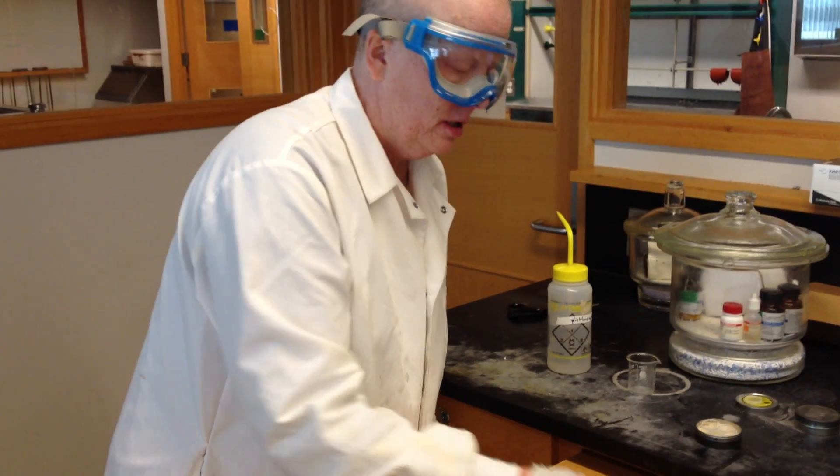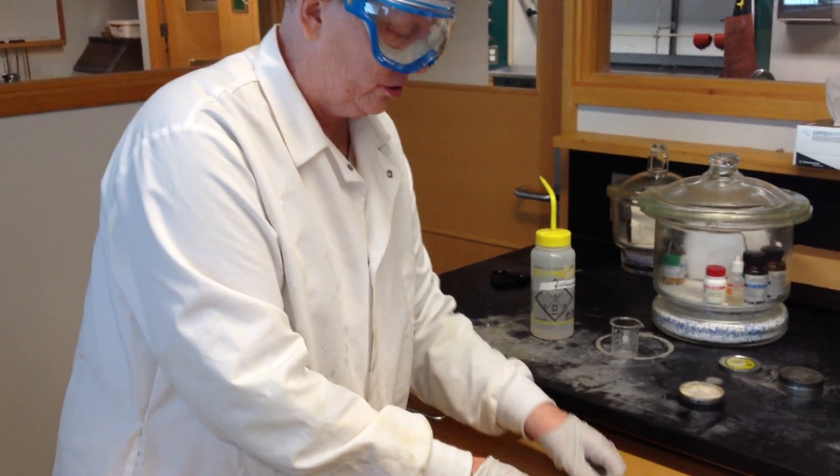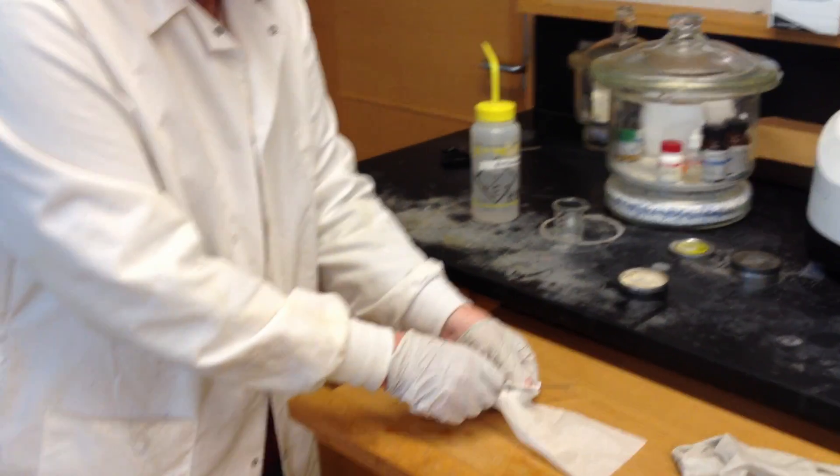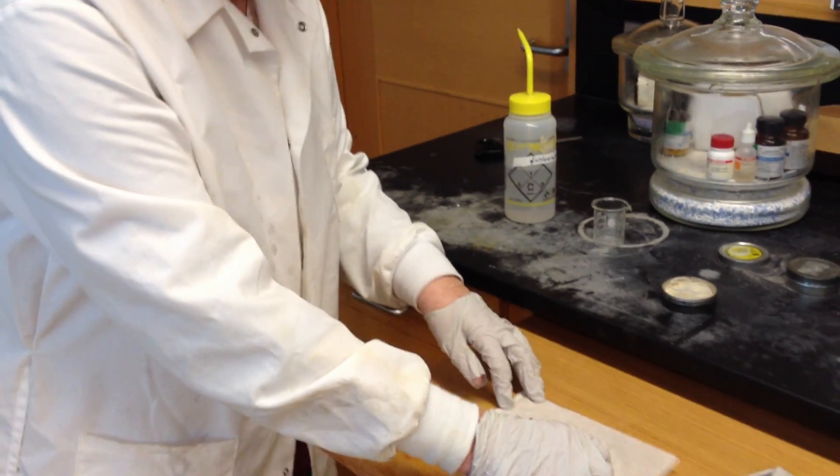Why are they made out of NaCl? They're made out of NaCl because sodium chloride does not absorb in the infrared. I prefer to use older cells most of the time because the etching in the older cell creates some grooves that will actually hold the sample.